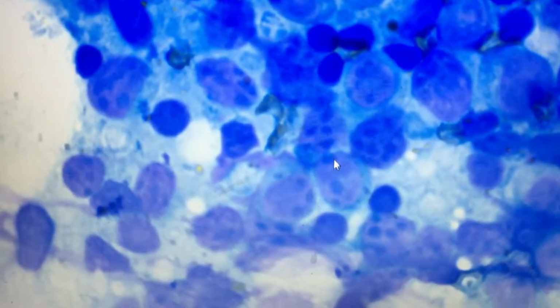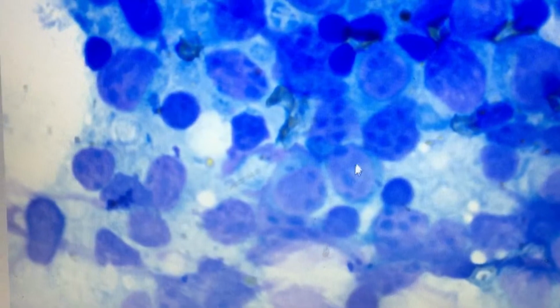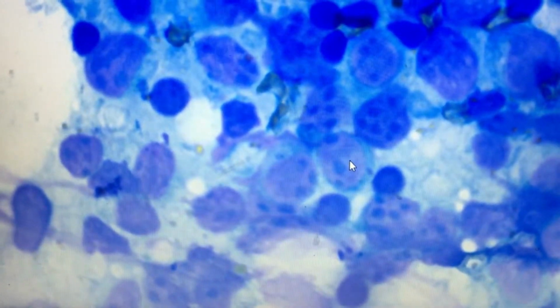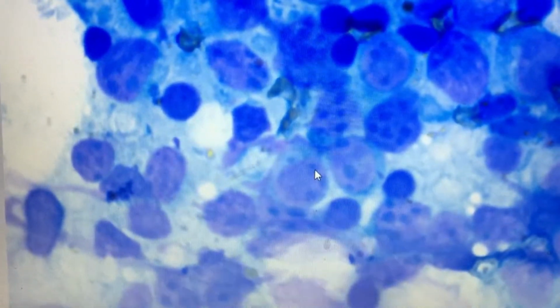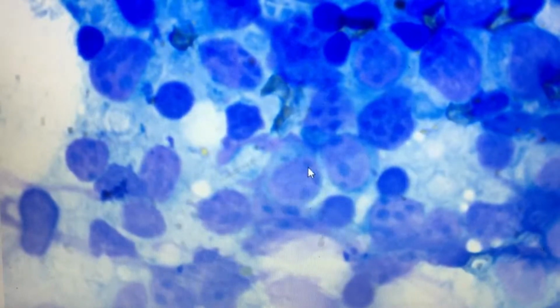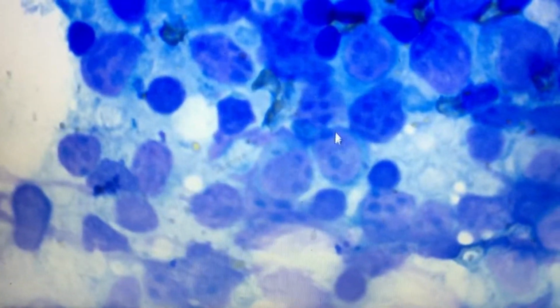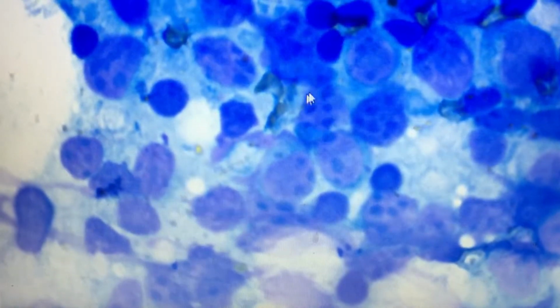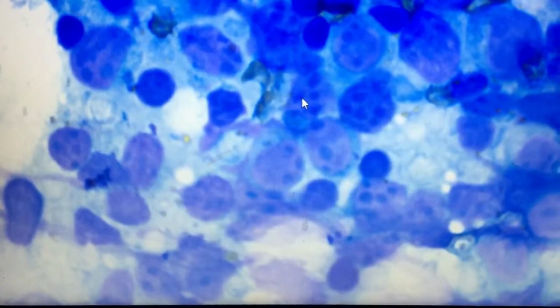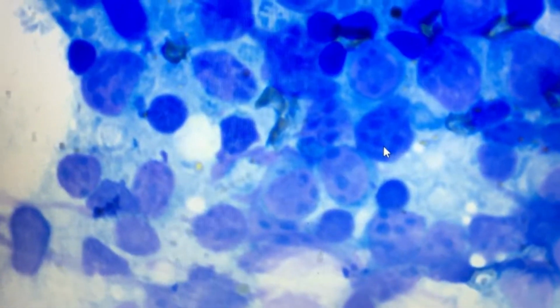You also need to mention where the nucleolus was placed. Usually the nucleolus is placed in the center of the nucleus, but sometimes they can also be present towards the margin and periphery. Here you can see they are placed towards the periphery. Here some are center, some are towards periphery, and here they are almost diffuse. They are everywhere. One is in the center, one is in the periphery. So you need to mention these also.